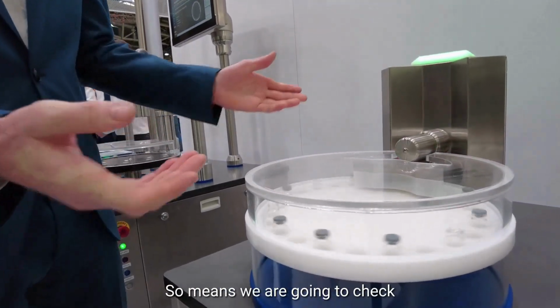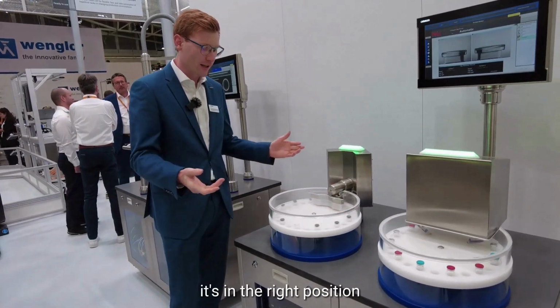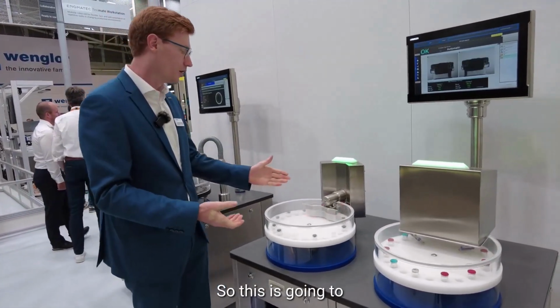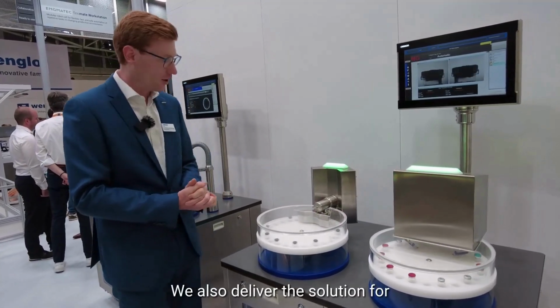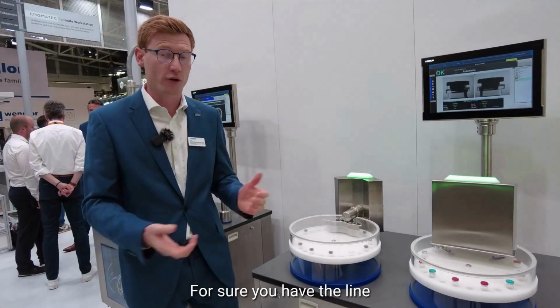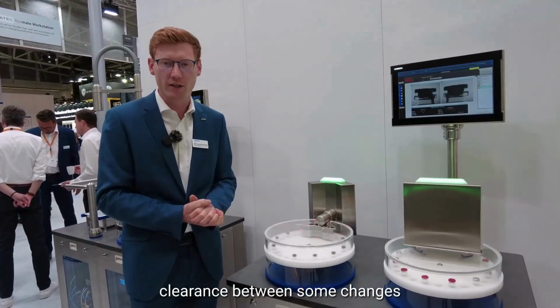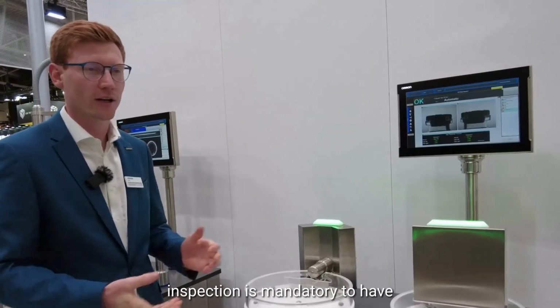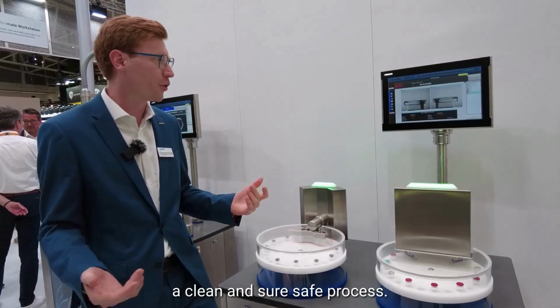So that means we are going to check if a stopper is in place or if it's in the right position, if the gap is there, etc. So this is going to be checked here. We also deliver the solution for inspecting the stopper, if it's the right stopper. For sure you have the line clearance between some changes on the machine, but control is mandatory, inspection is mandatory to have a clean and safe process.